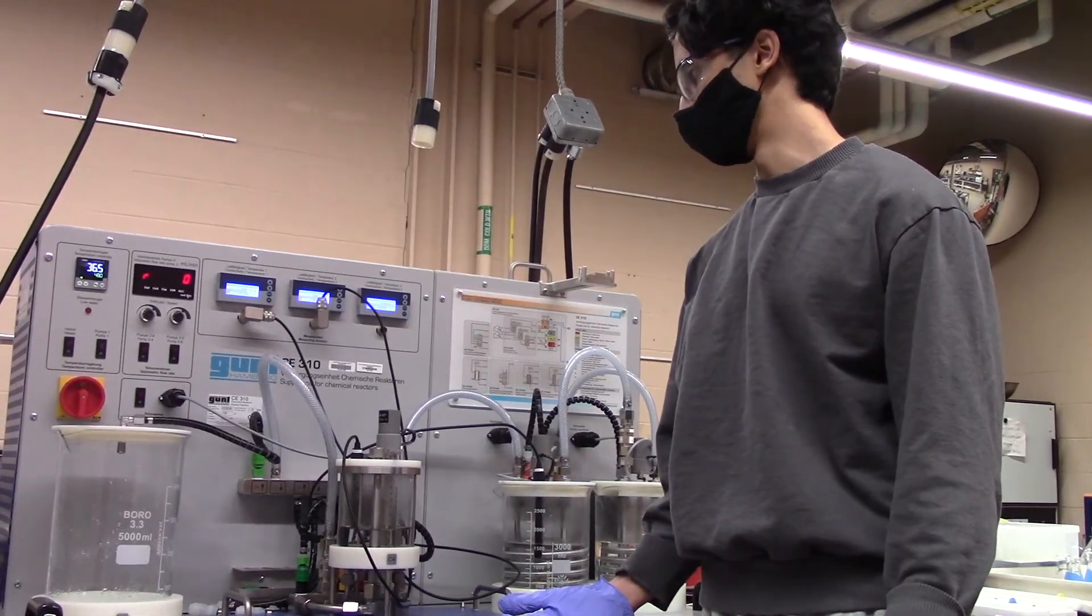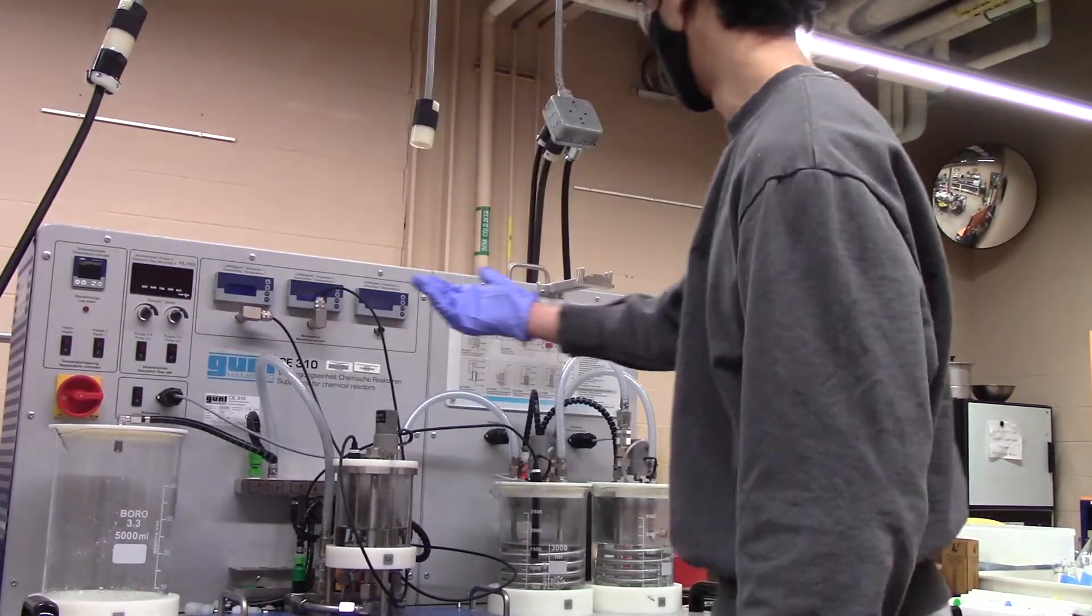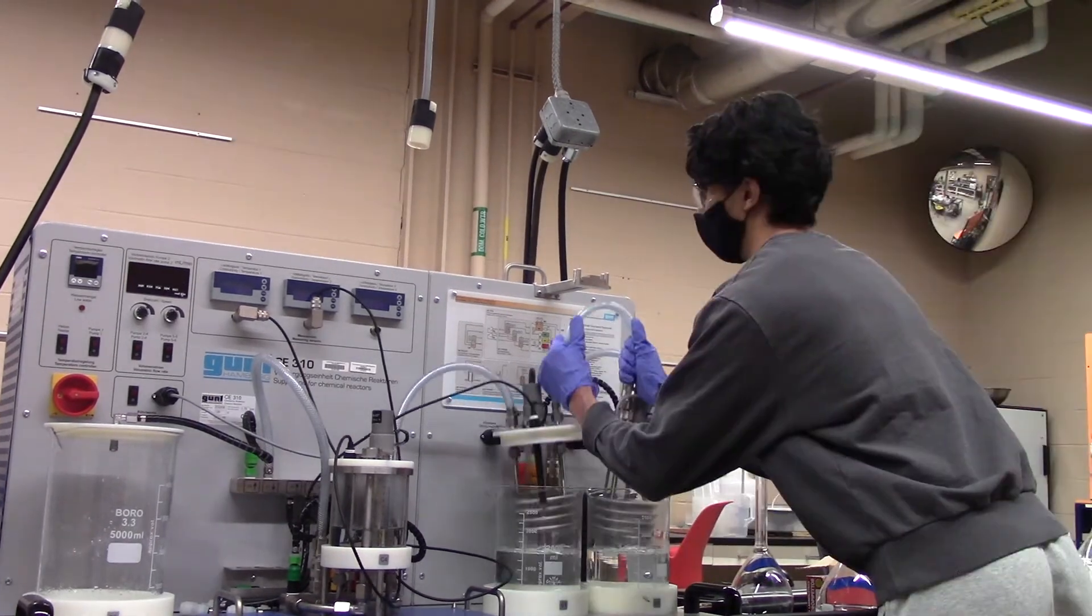Once all of your data is acquired, it is time to shut down the system. You will want to power off all of the switches and turn off the CSTR. After doing so, once again suspend your pump lines and remove the solution beakers.